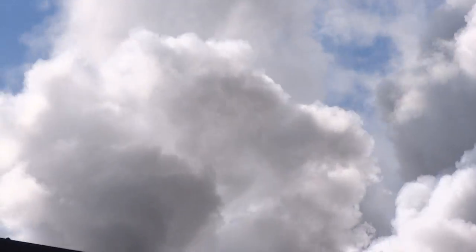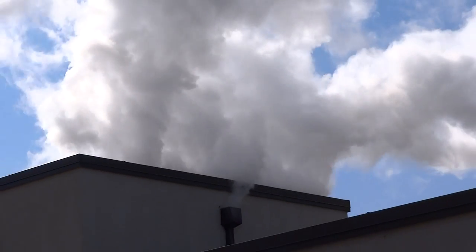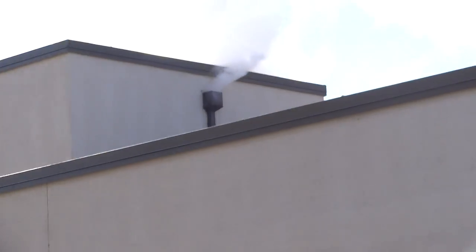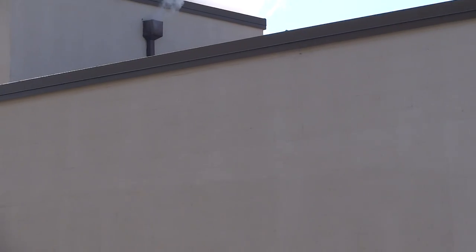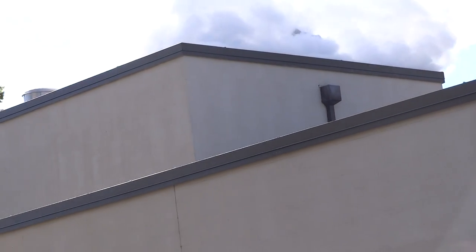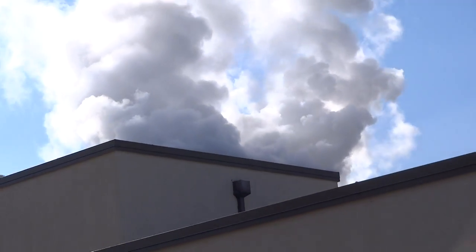Yeah. I was surprised when it went off. There was a little pop before it came off. Yeah. A little like a firecracker. Well, that must have been the burst. But yeah, throughout this, it was a big pop, then all of a sudden... Oh, look, it's coming out of the bottom of the rain gutter. You really shouldn't be in the room at this point. Is there anyone in there? No, everybody left as far as I know. Was that the pop-off that made that sound? That was the pop-off popping. That's why they call it a pop-off.